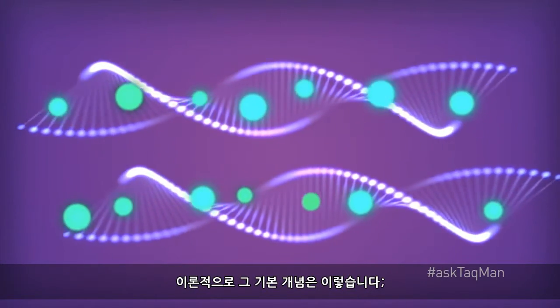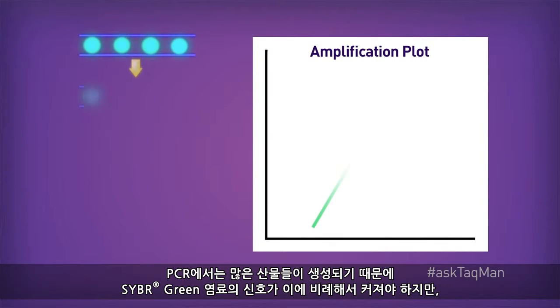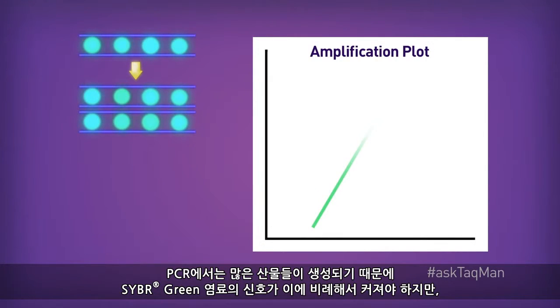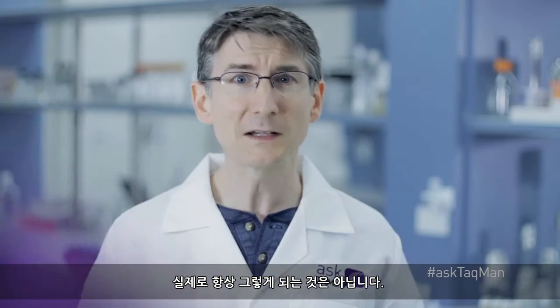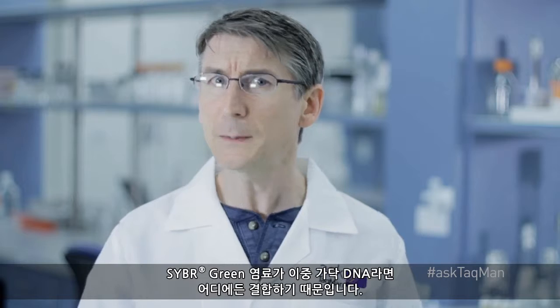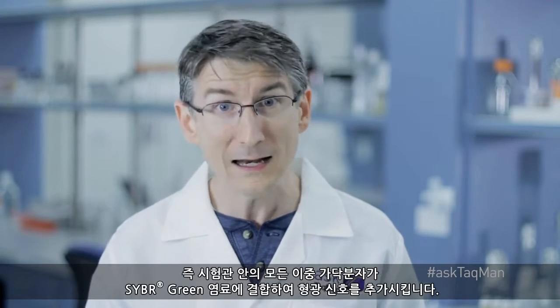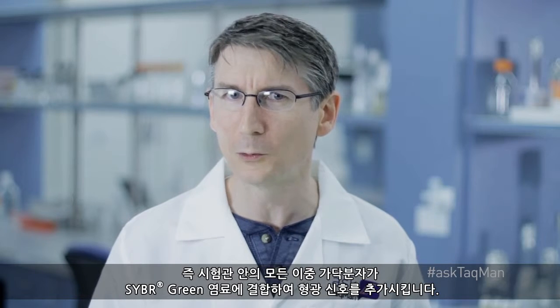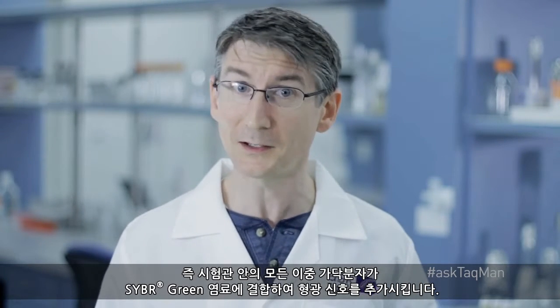At least in theory then, the basic idea is this. As PCR creates more and more product, the signal of SYBR Green dye goes up proportionally. In practice though, this doesn't always happen. That's because SYBR Green dye binds to any double-stranded DNA, meaning every double-stranded molecule in the tube will bind SYBR Green dye and add to the fluorescent signal.